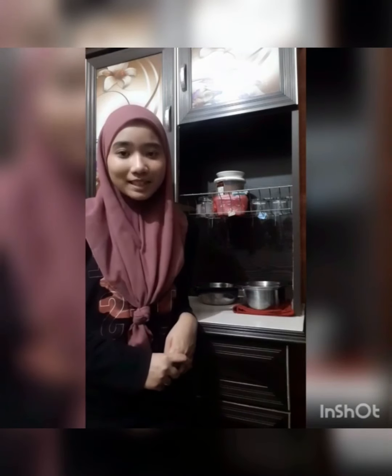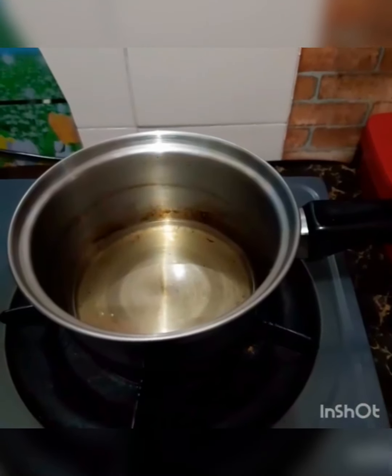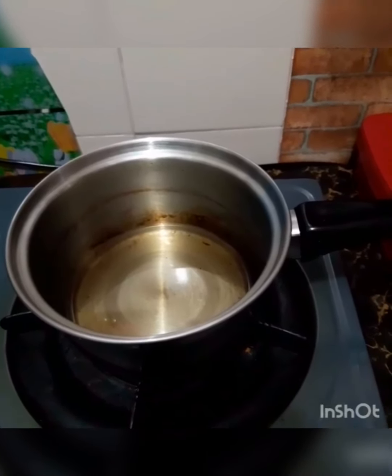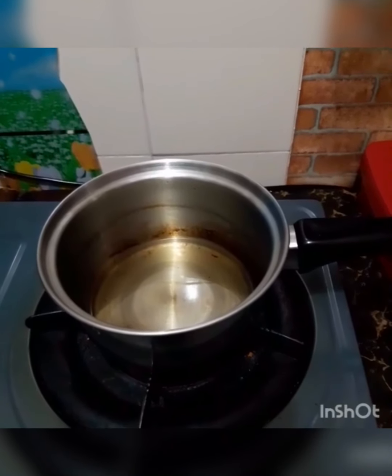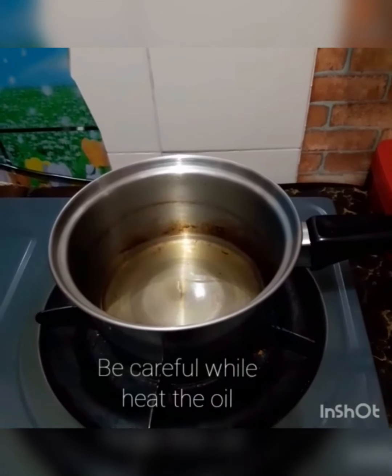Firstly, the blended sample must be completely dry before we start the test. Then heat the filtered oil to 130 degrees Celsius for 5 minutes immediately before making the test. We must be careful while heating the oil.